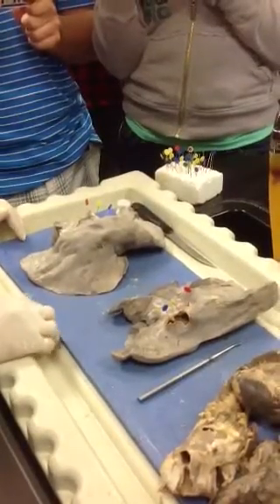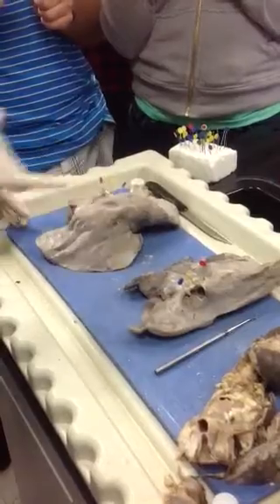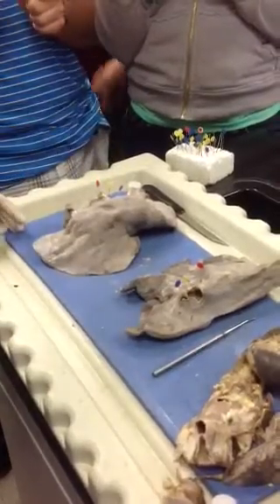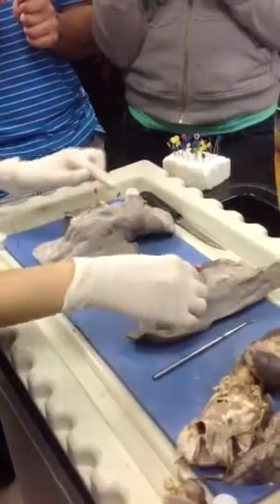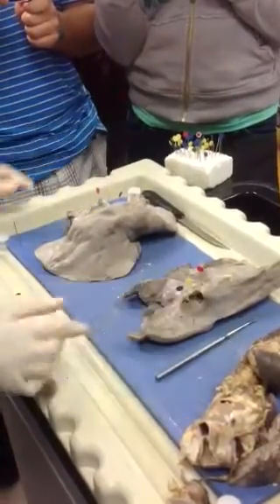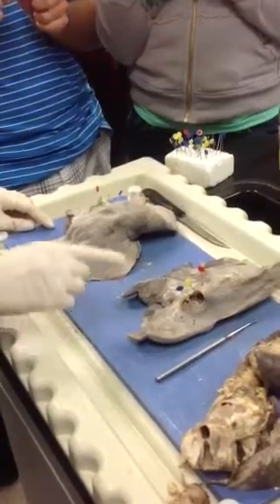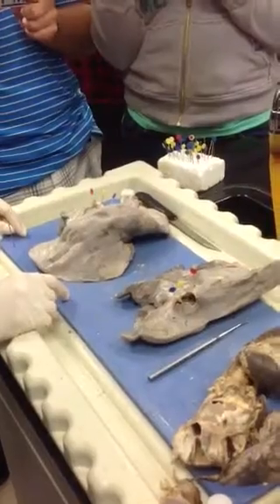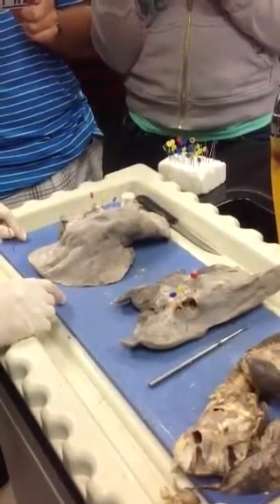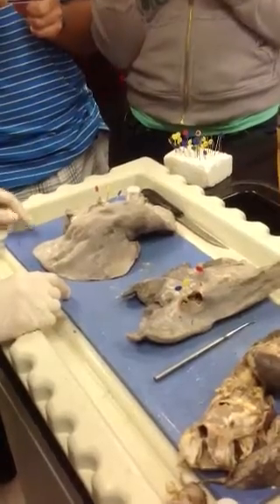So yeah, just know what side are we looking at? Ventral. If we flip it, it's dorsal. What structure are we looking at? Here, at the yellow. Primary bronchus. What structure are we looking at at the blue pin? Pulmonary artery. Pulmonary artery. At the red? Pulmonary vein. Pulmonary vein.